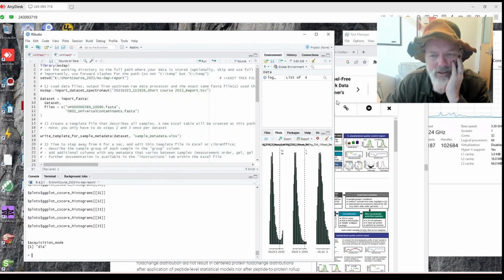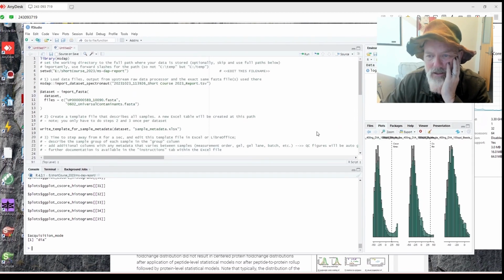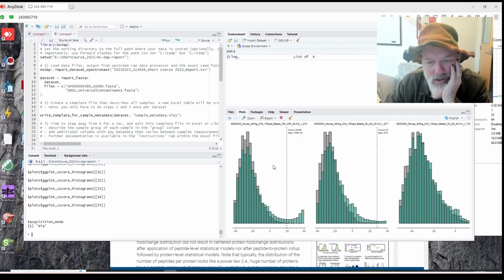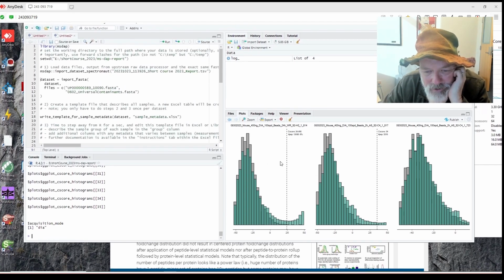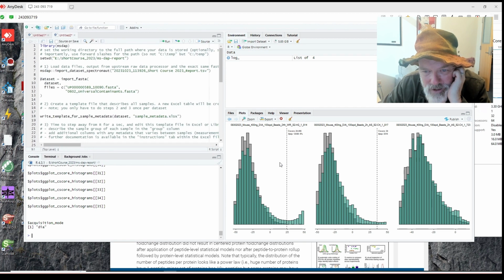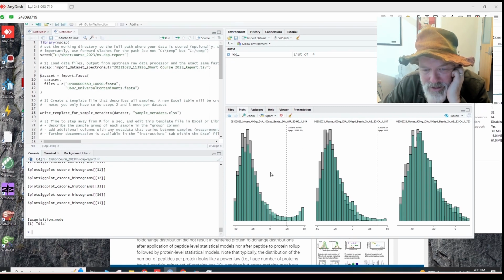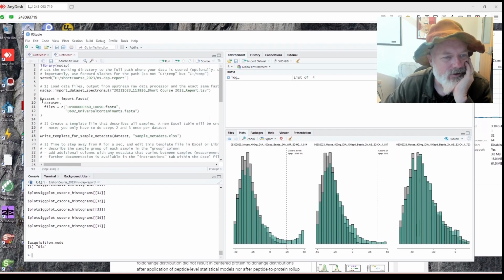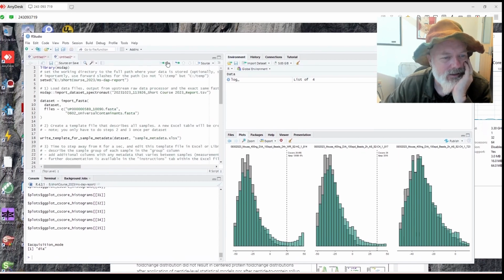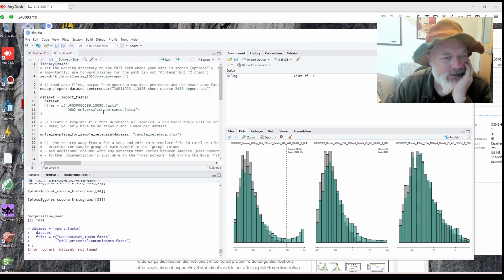All right, so it loaded. What did it do? All right, cool. Okay. Oh, that's neat. All right, so it's showing you some graphics for the file. I don't know what that means. Let's see, C-score. This is Spectronaut stuff. Number of peptides, I think. Okay, so let's see here. That all seems okay. All right, so now we're going to load our FASTAs. And we're going to hit run. Boom. Error. Dataset, object dataset not found.